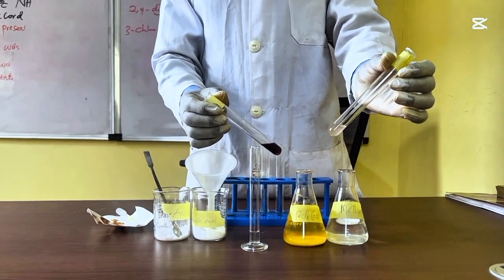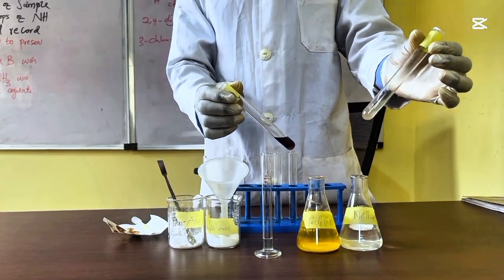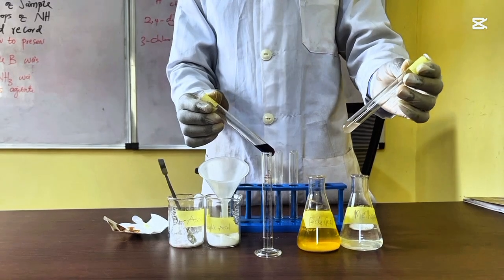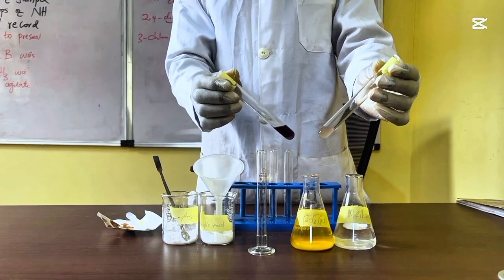Now remember also that this purity test is not a standard purity test of pharmaceutical drugs, but just a laboratory test. And so in no account will you think that this is pure and take any of the synthesized aspirin as a drug. This is just for your knowledge.